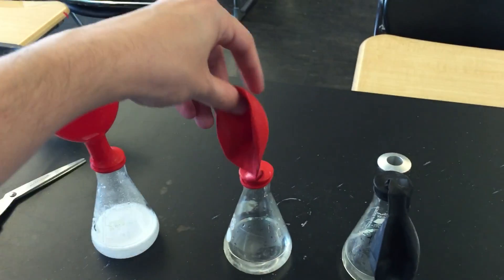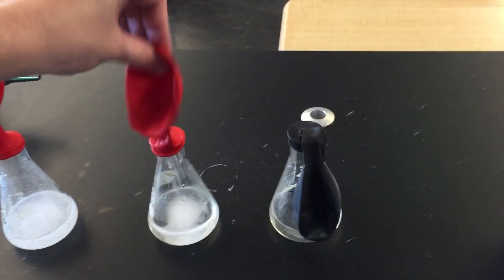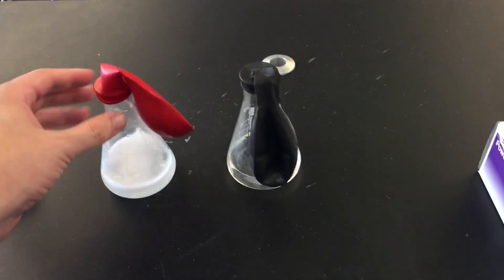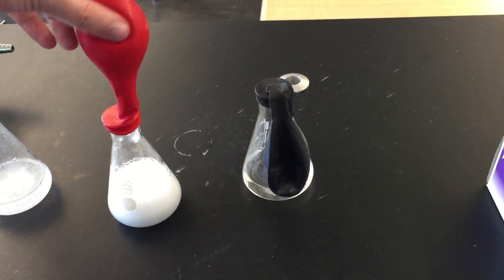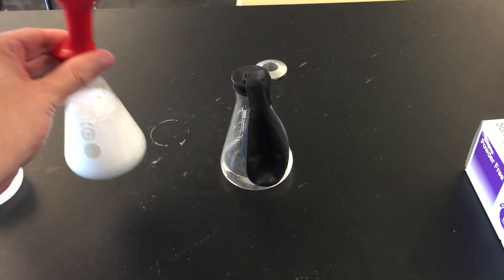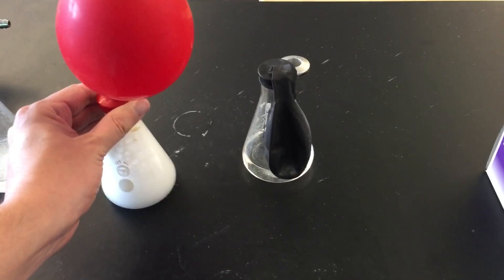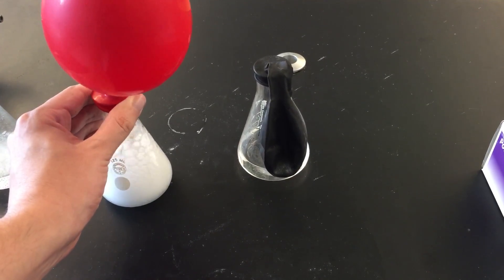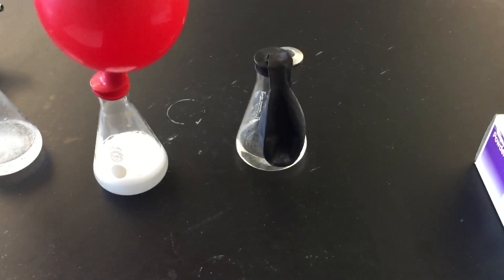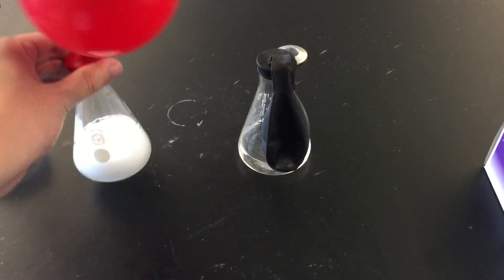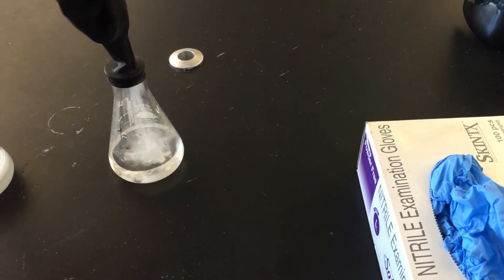So now here is our second one. There we go. And then we have our third one. So we'll be flipping that one around.